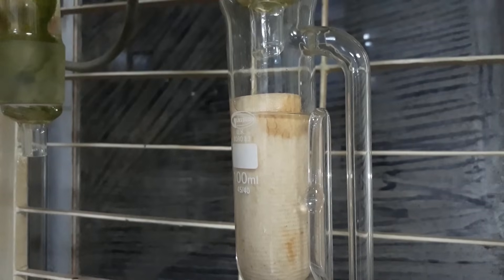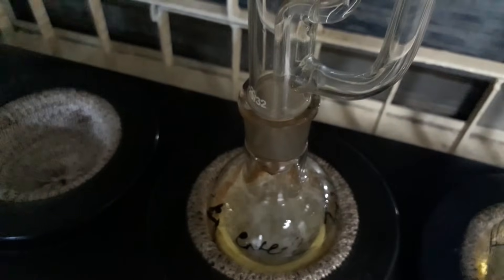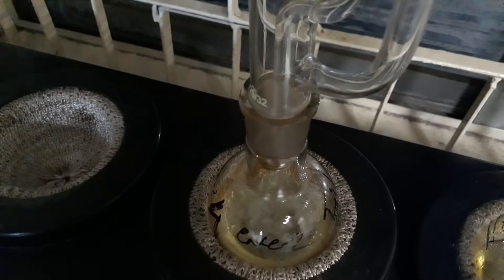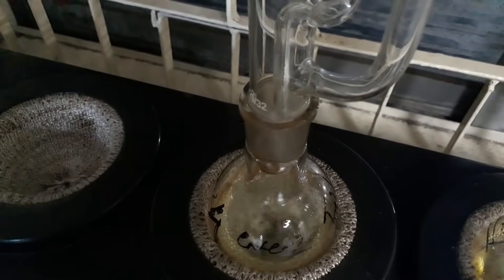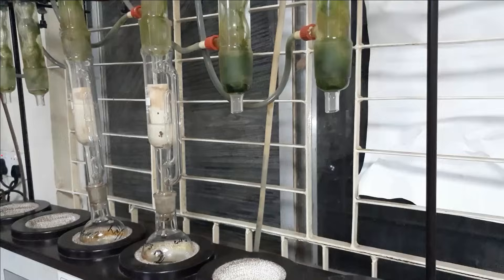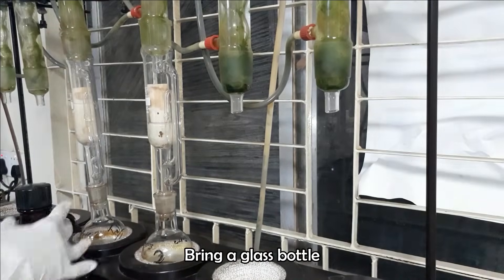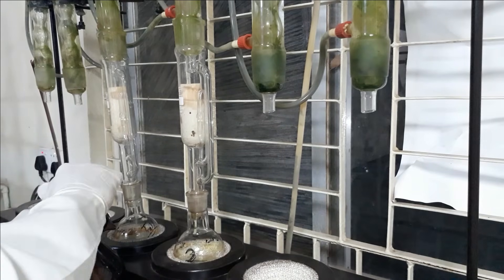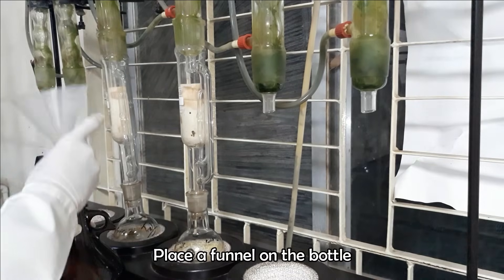N-hexane is used as a solvent for fat, which dissolves out the fat from the sample into the flask. Run the apparatus for 6 hours. After 6 hours of extraction, raise the thimble out of solvent and collect the waste N-hexane in a glass bottle.